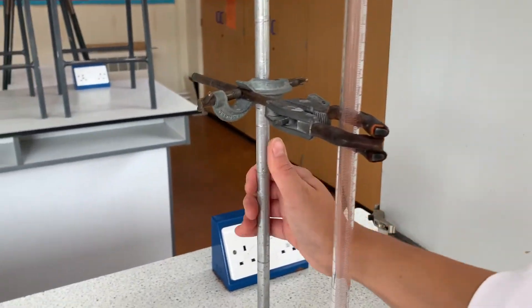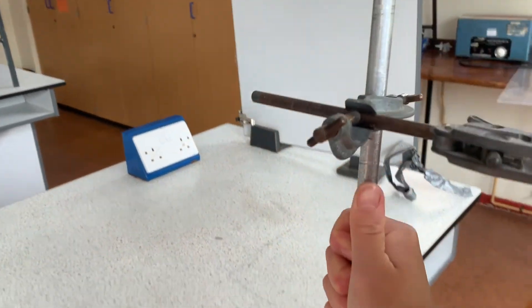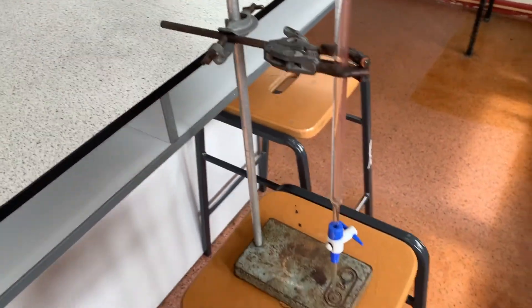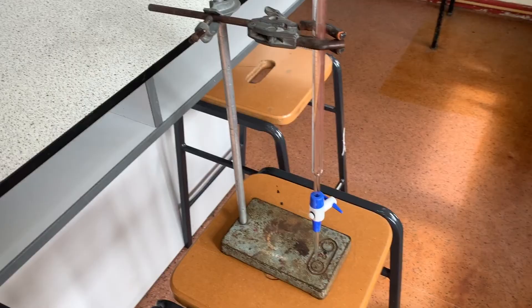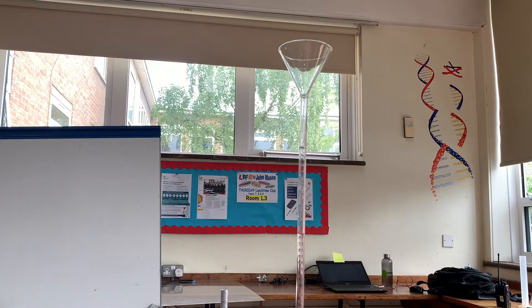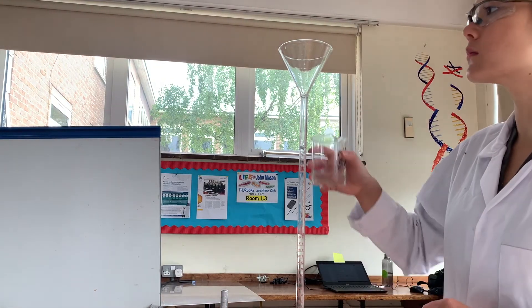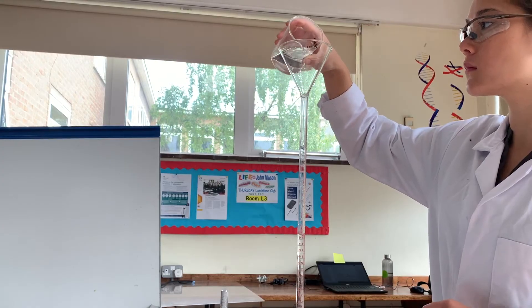For safety, a burette should not be filled from above your eye line, so you may need to place it on a stool while you fill it. Here I am filling the burette with the sulfuric acid of unknown concentration.